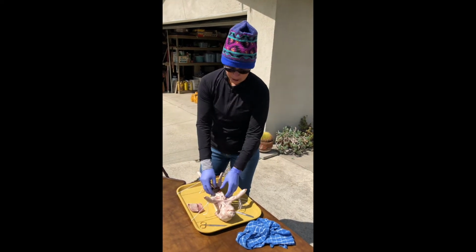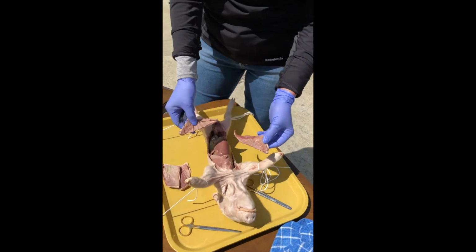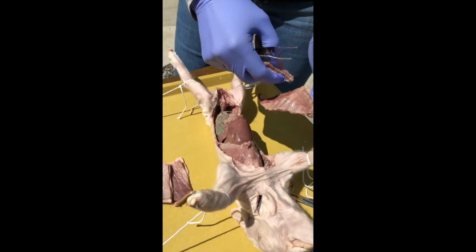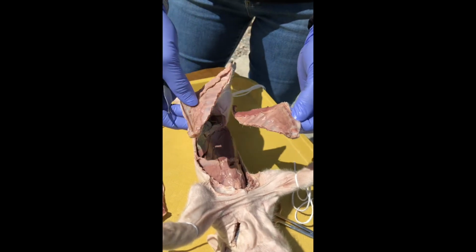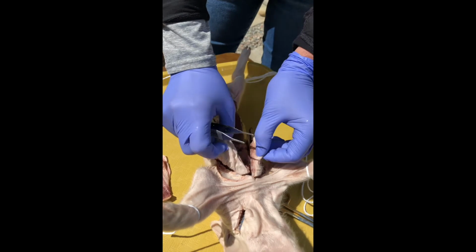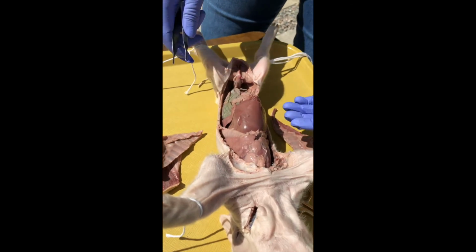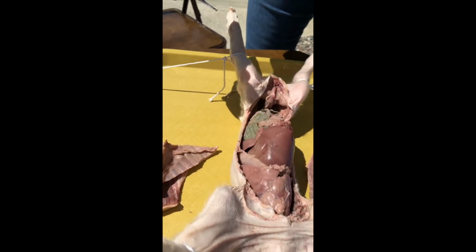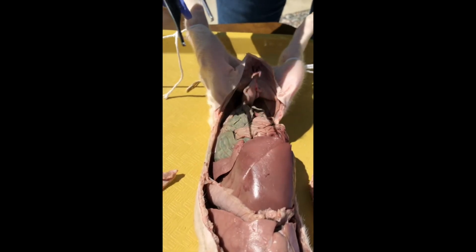So we have the chest wall off. The chest wall is built the same as the abdominal body wall, except that we also have the ribs and sternum, and they've been cut away. Now that's exposing some of the structures. We can see superficial structures, and let's just go ahead and take a tour of the structures we can see superficially now.